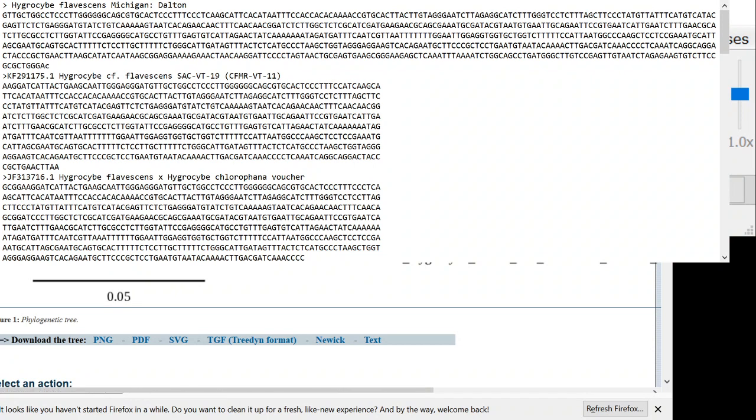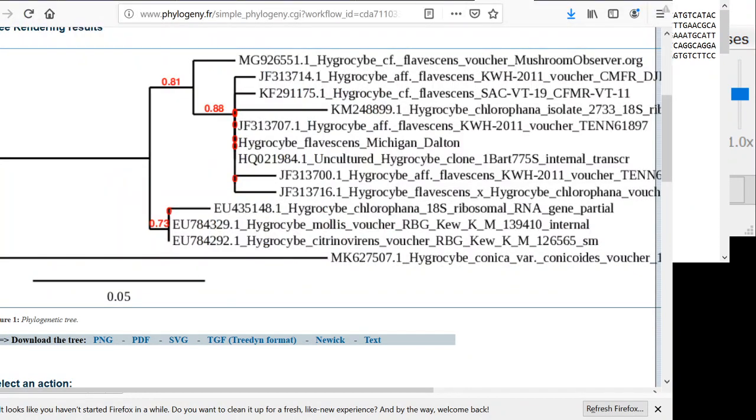And so here it is. Oh, it looks like we have the notepad on top. So I have to put this down so you can see what I'm doing better. Firefox needs to go up. Okay, so here it is.